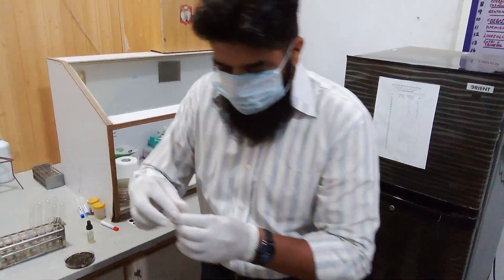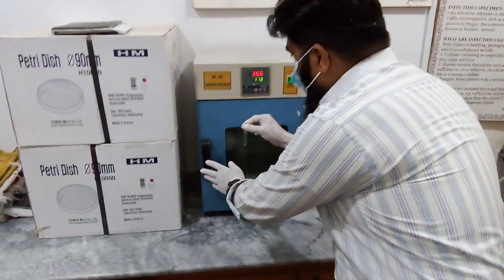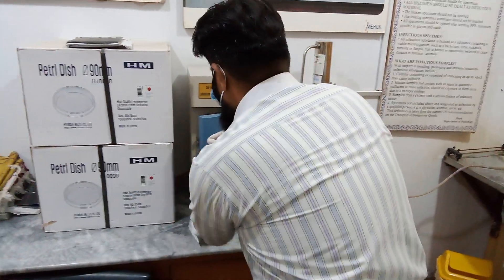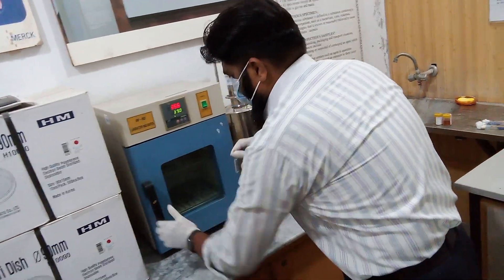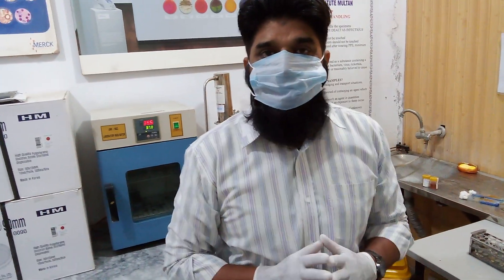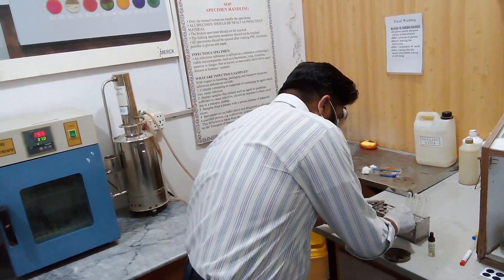Now we will place this test tube into the incubator and we will set the temperature at 37 degrees centigrade. We will wait for 24 hours. After 24 hours we will pick out the test tube from the incubator and we will see the following results.